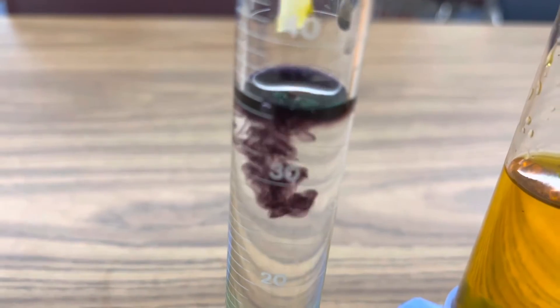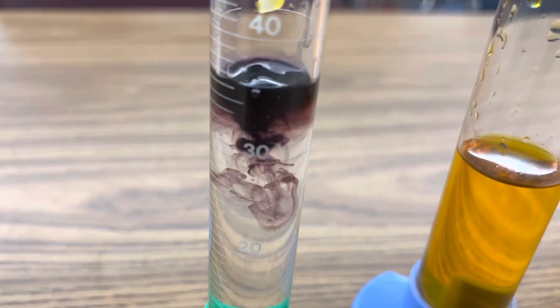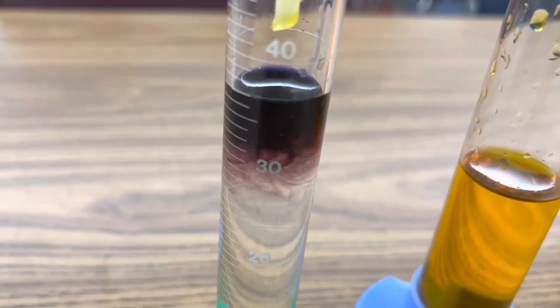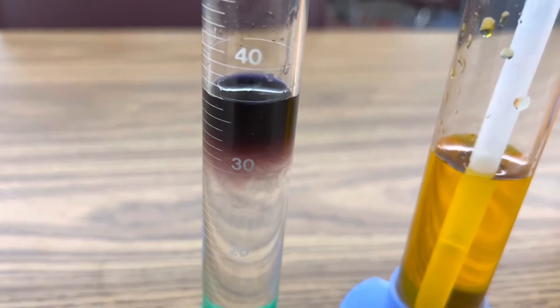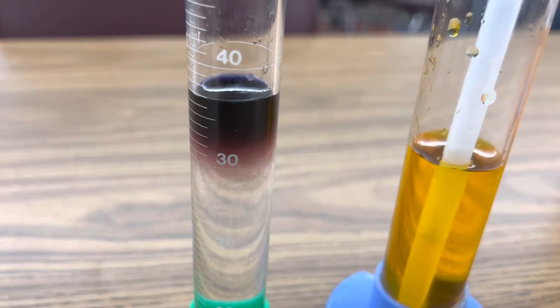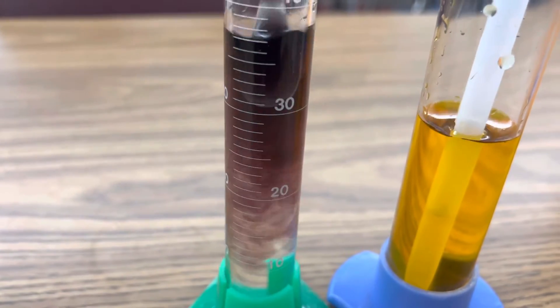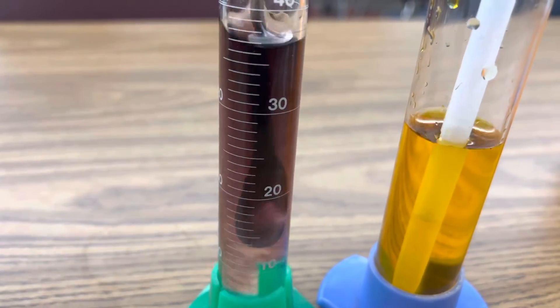Look at that — just instantly. Isn't that amazing? From that bright yellow to kind of a dark blue color. And if we stir it up a little bit, it's unstable and it'll slowly become clear again.